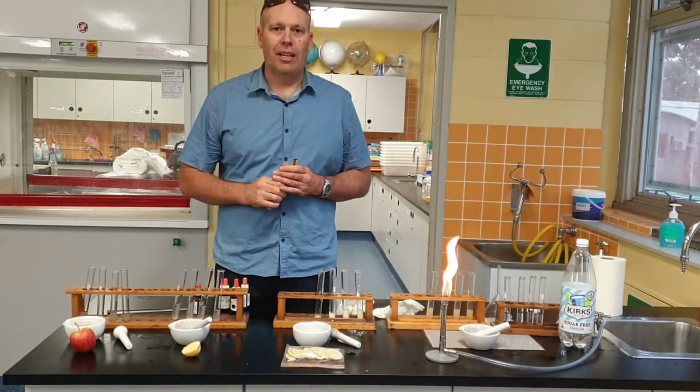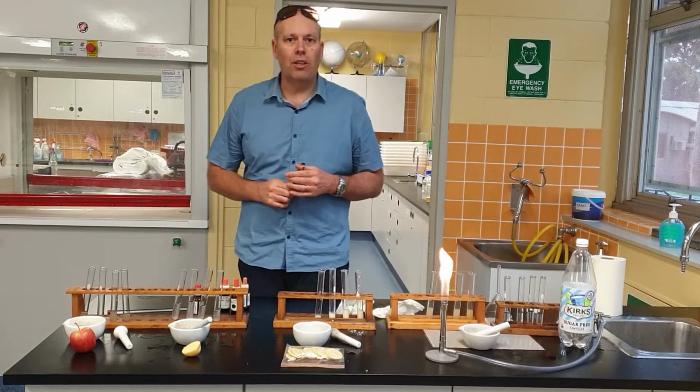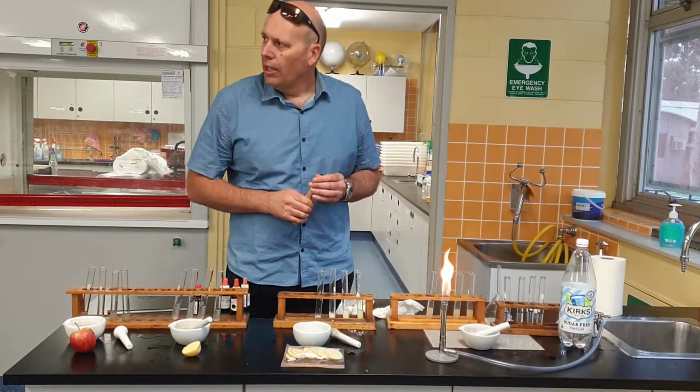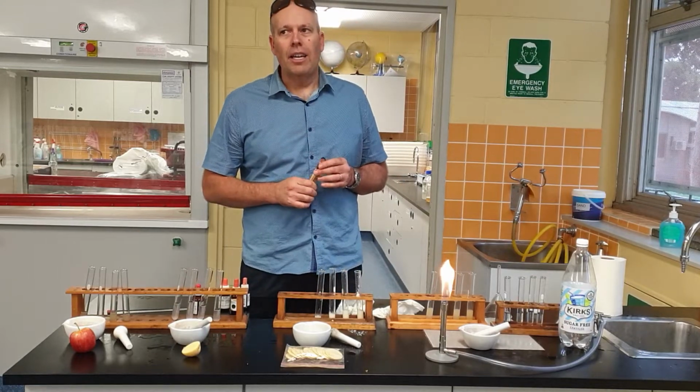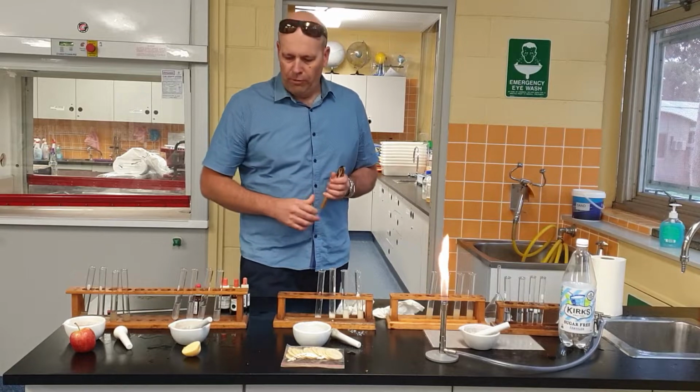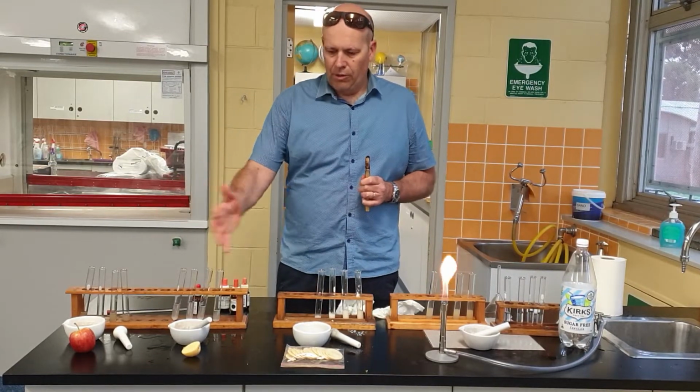Food testing. Okay, food testing. Last video I showed you, we identified the tests of how we identify these food chemicals. And today what I'm going to be doing is testing some different foods, to see whether these foods contain different chemicals.